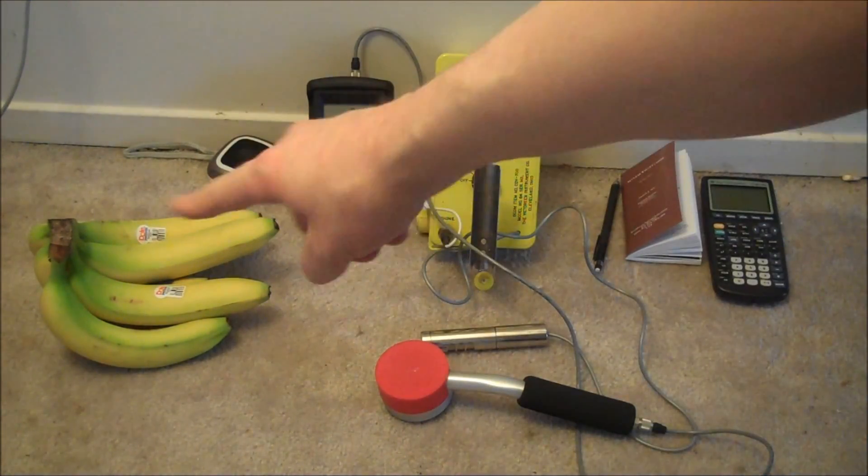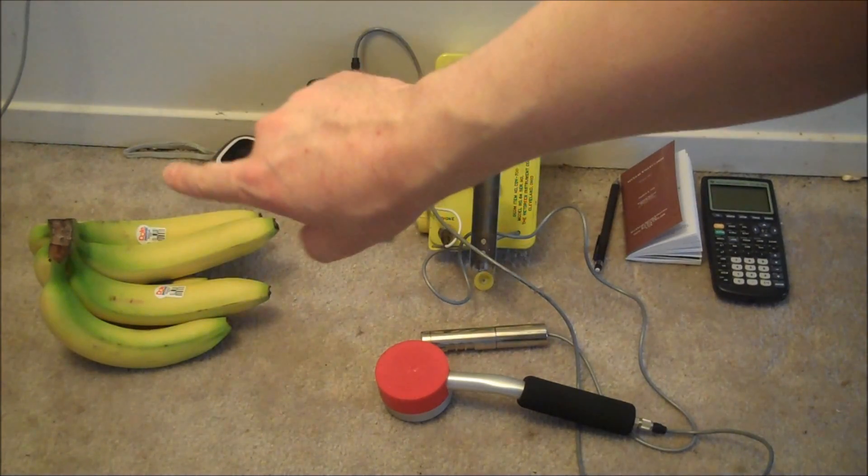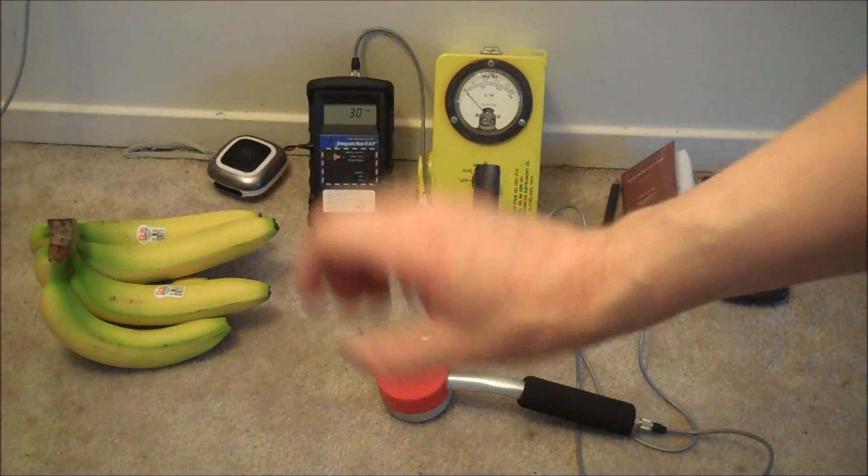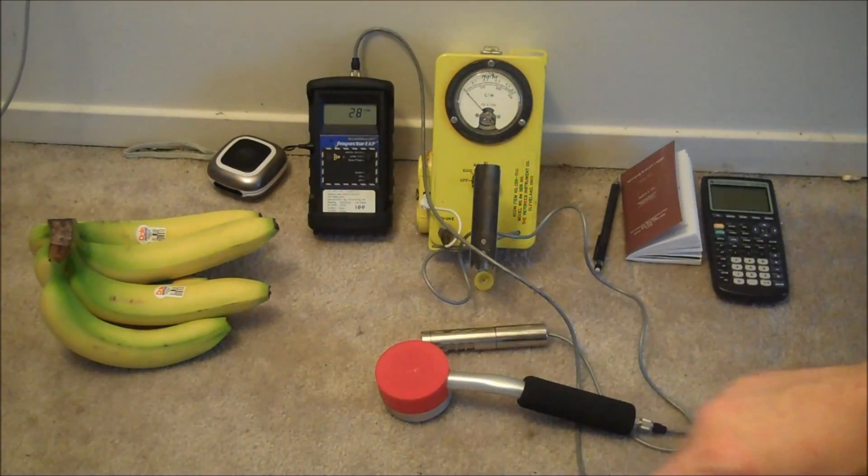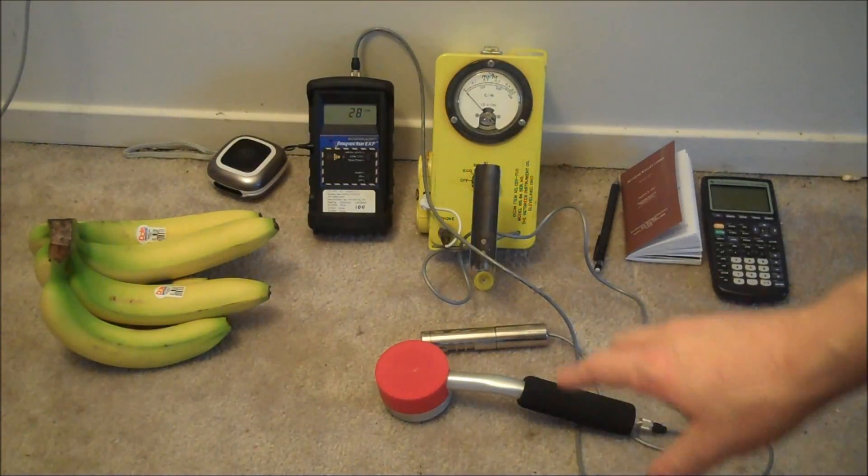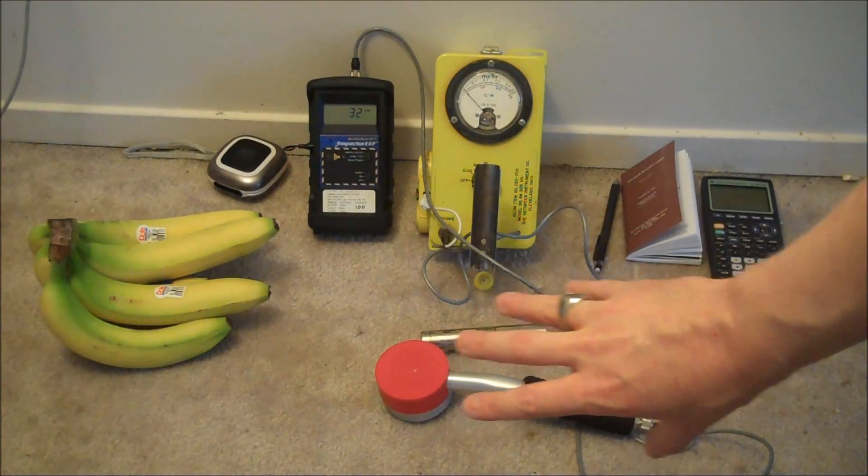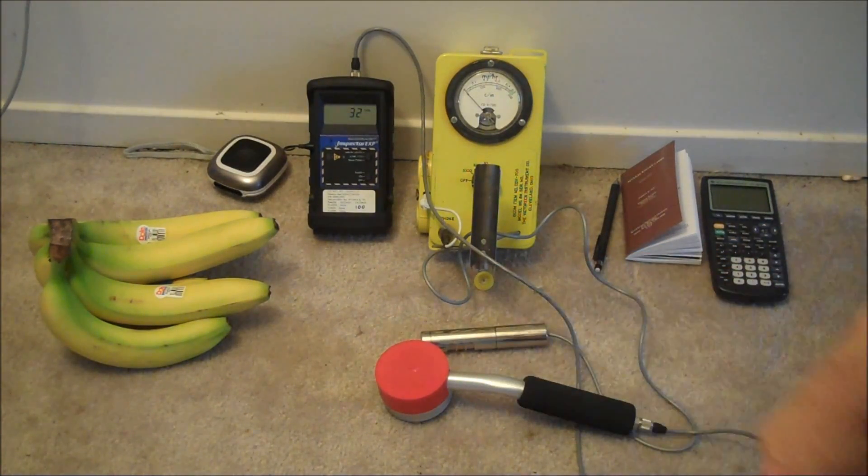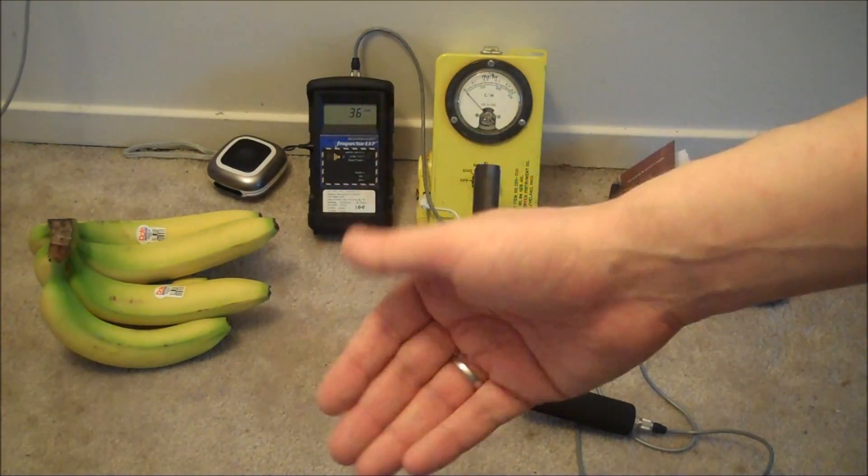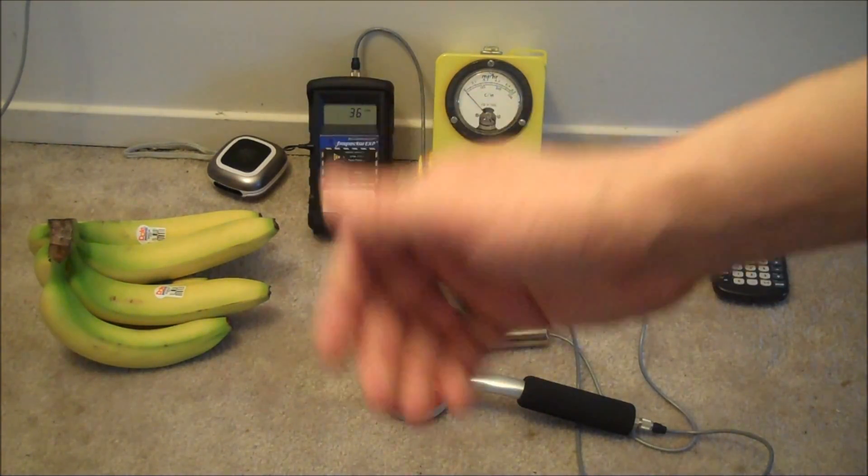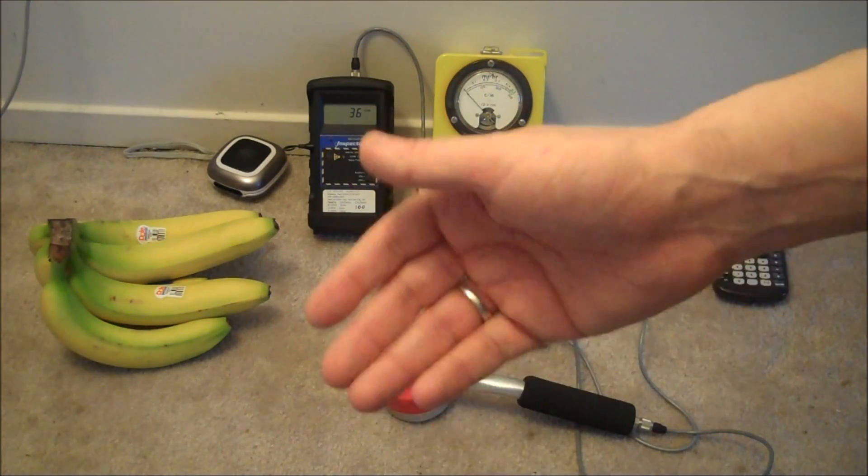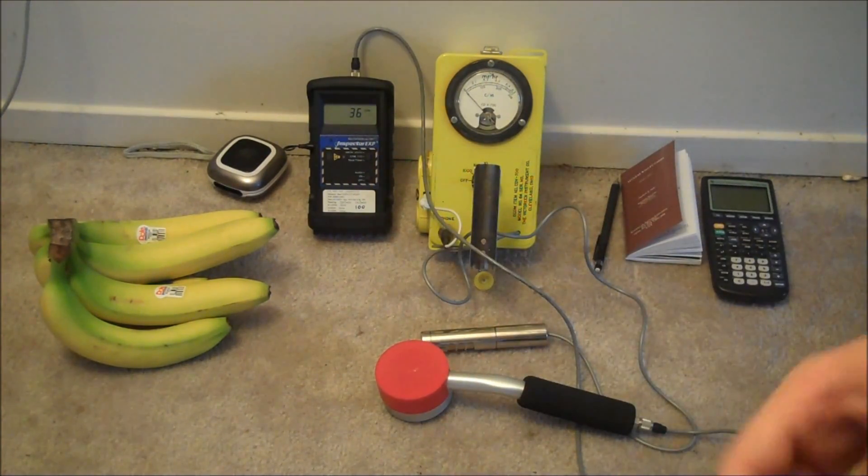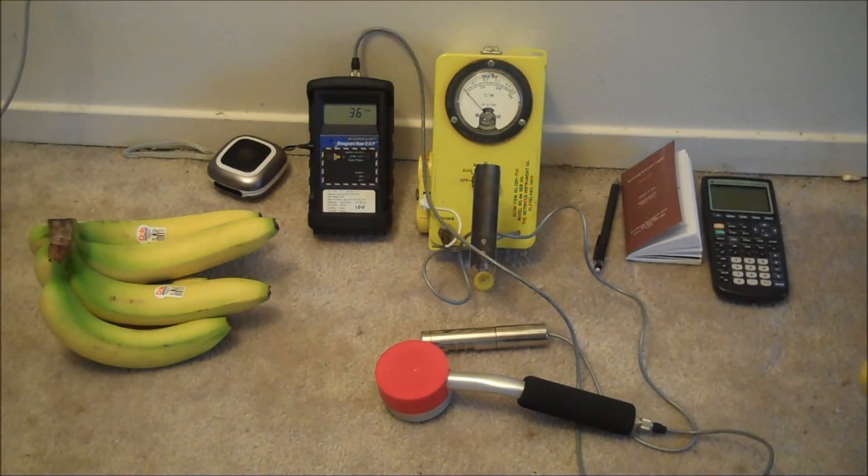Anyhow, bananas are as a result mildly radioactive in a very small amount. I wanted to see if I could detect it. I've tried with Geiger counters before with mixed results. So today I wanted to try gamma spectroscopy using a gamma scintillator.